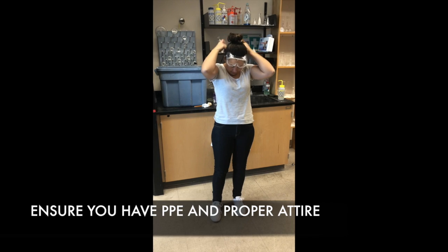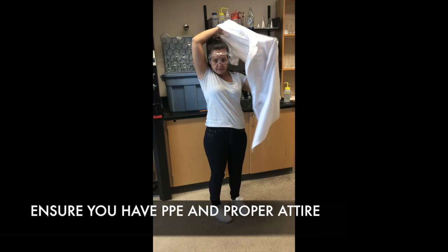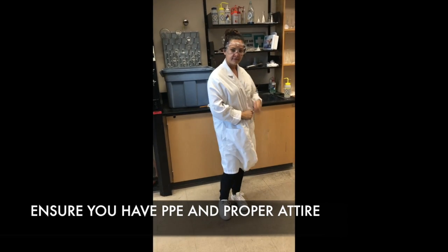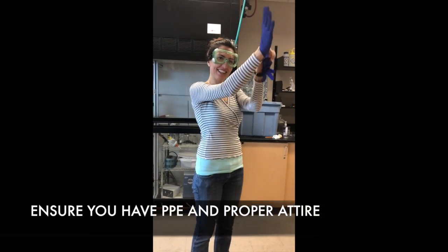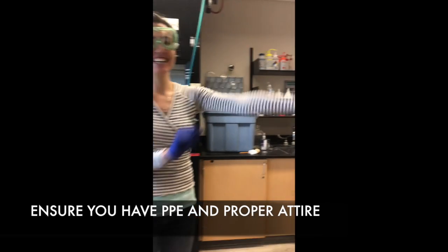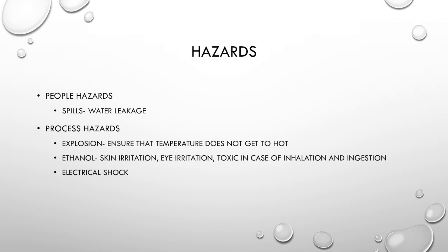You must wear your goggles at all times, as well as your lab coat to prevent chemicals from getting in your eyes or on your skin, as most of them are irritants. Gloves must be put on before handling any chemicals whatsoever. Handle chemicals like you would your phone. Don't drop them, as we don't want any spills to endanger you or your colleagues.